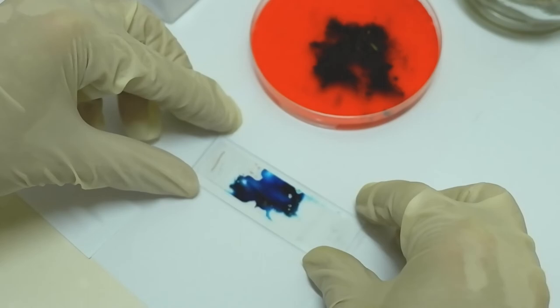Now this can be examined under the microscope for reproductive and other structures.